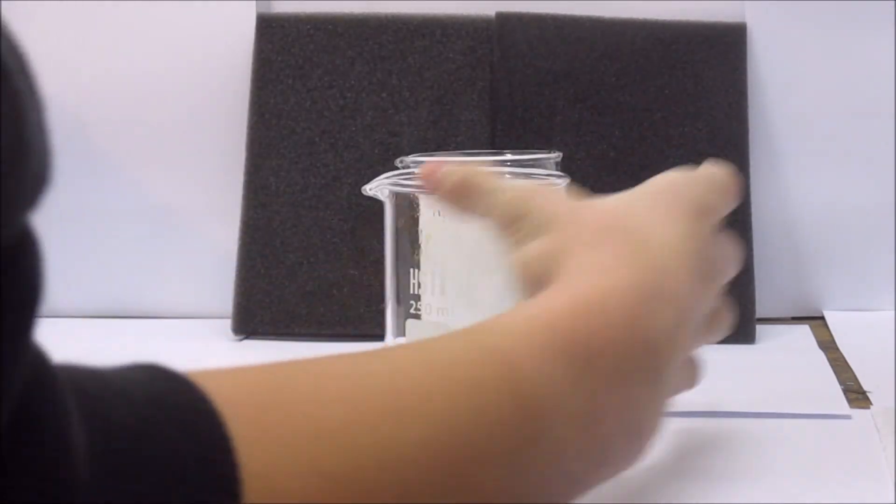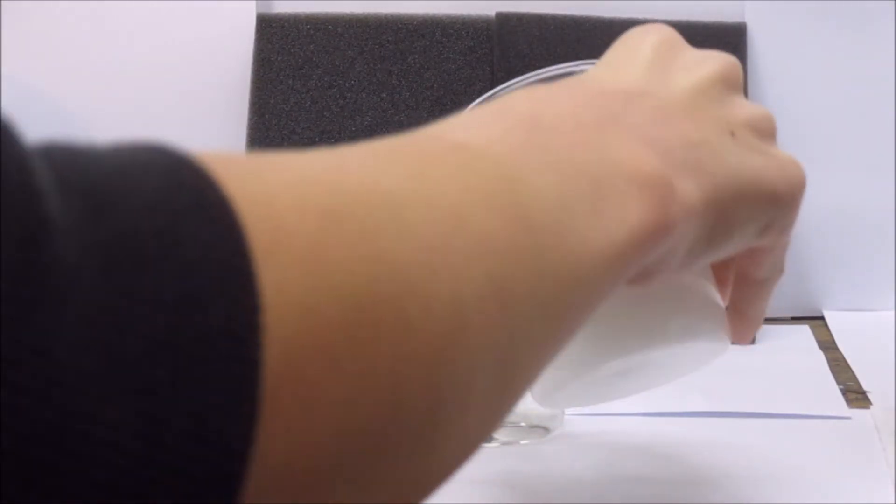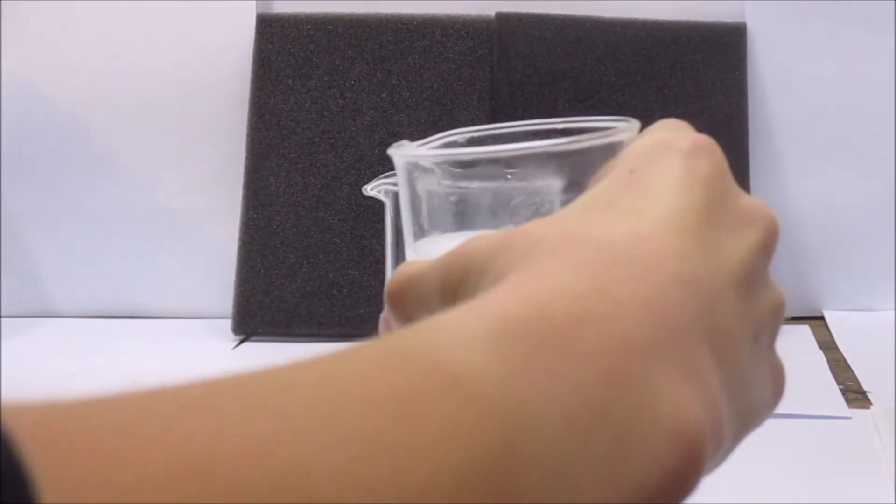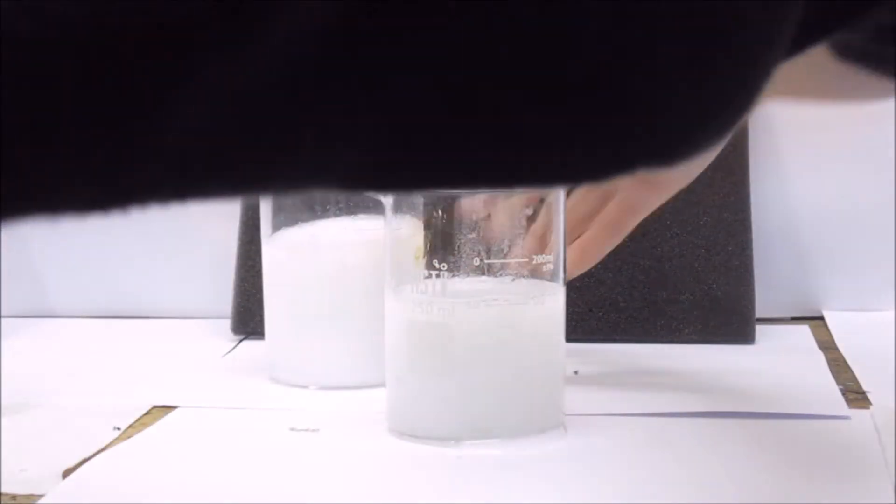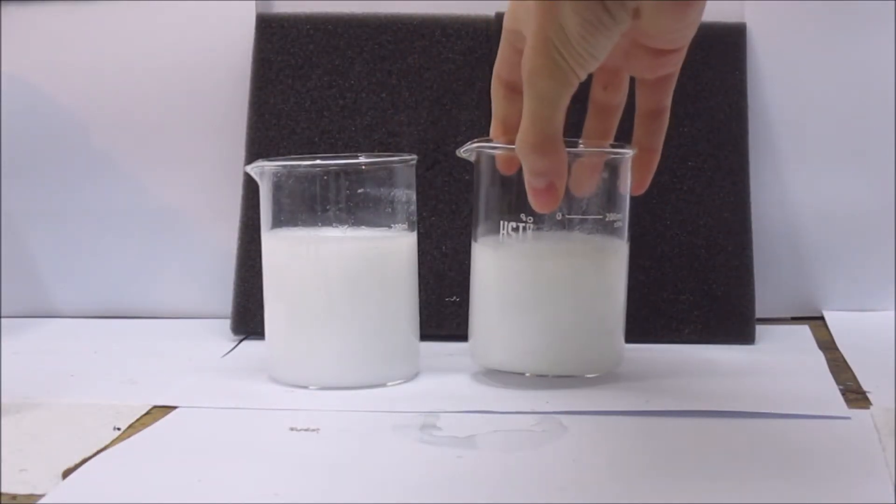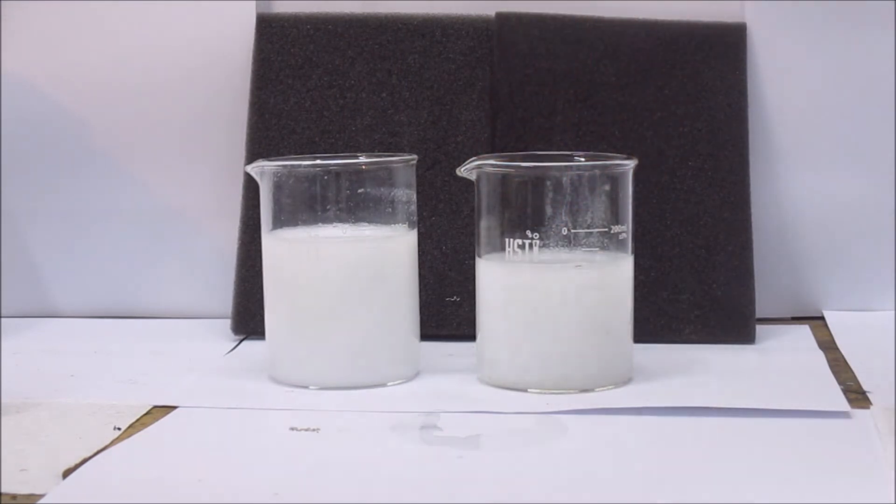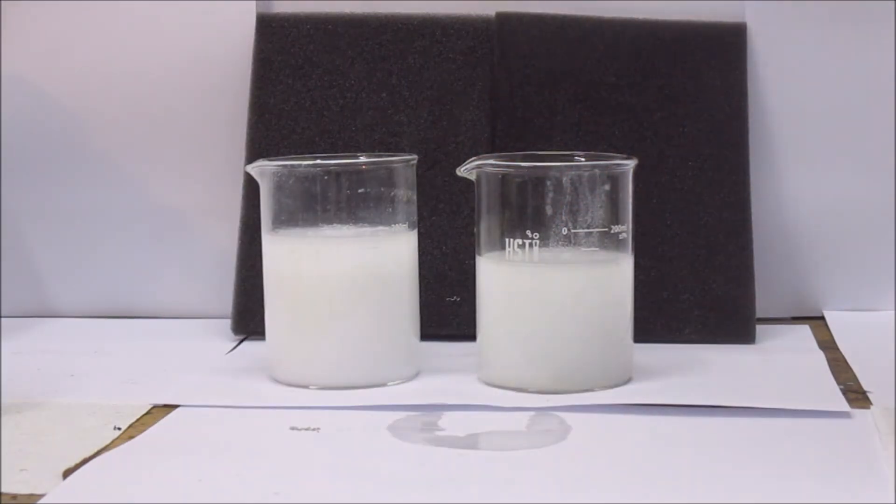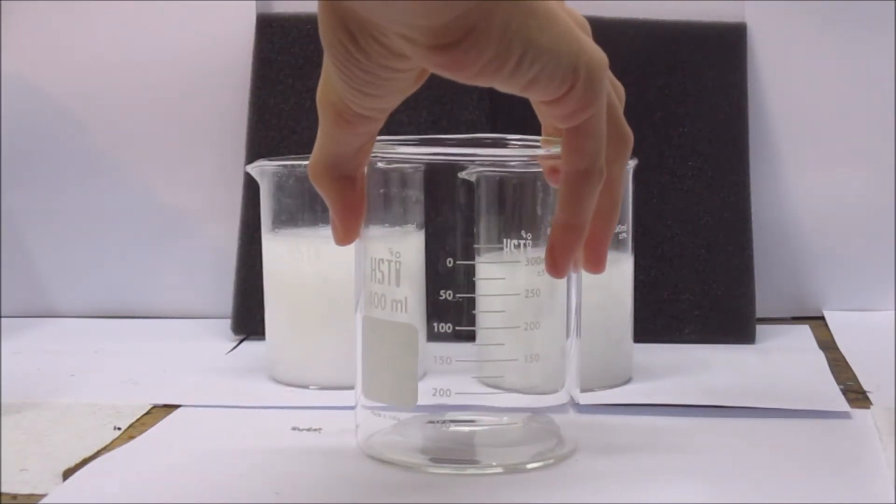There's actually too much liquid in the beakers, so I had to pour a little back into the other beaker. I then got a new, bigger beaker.